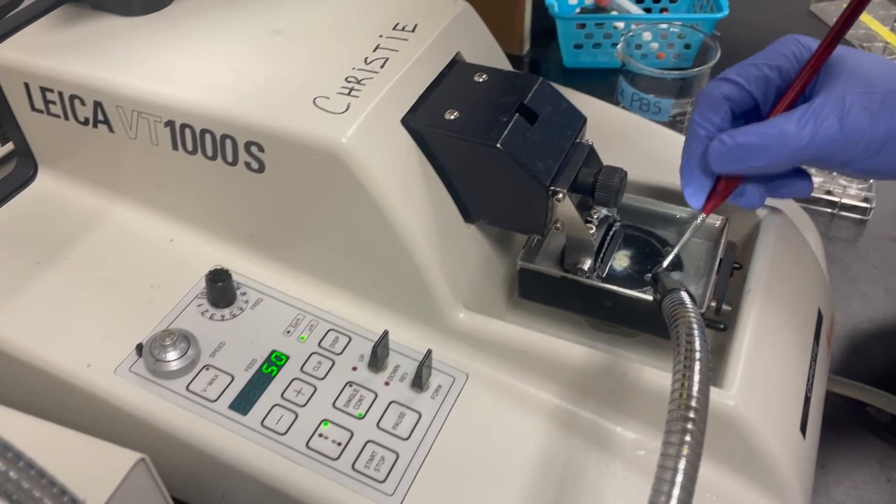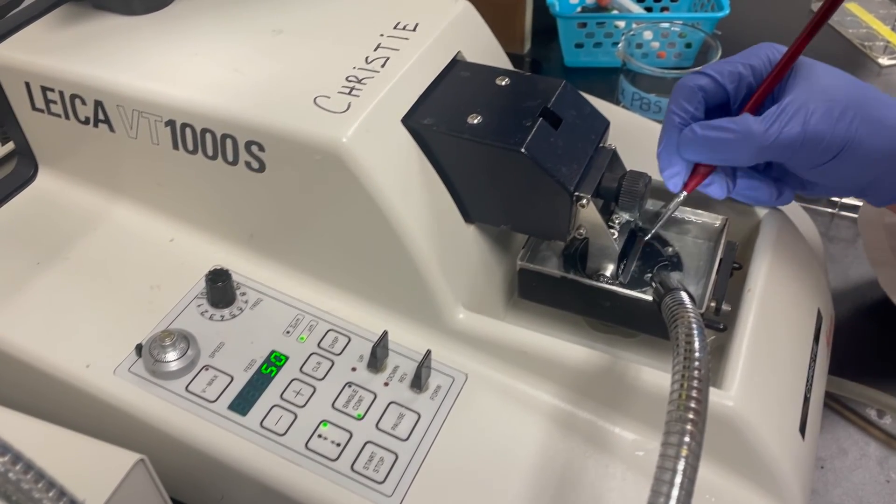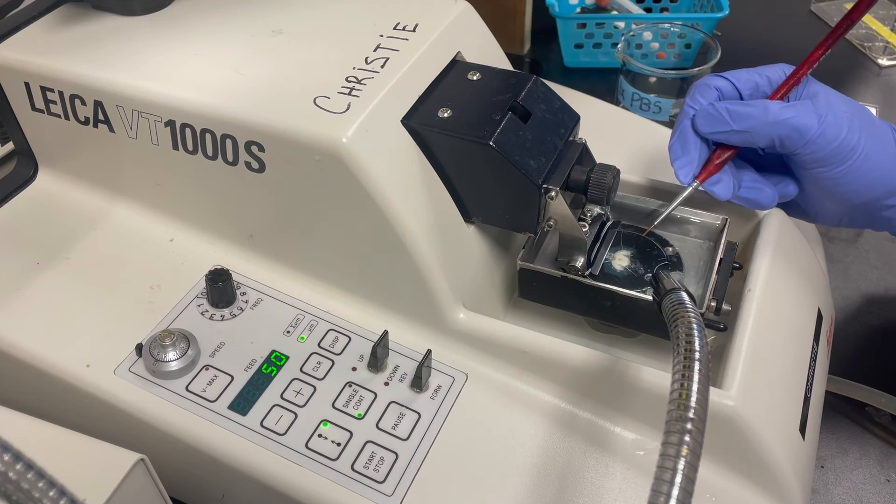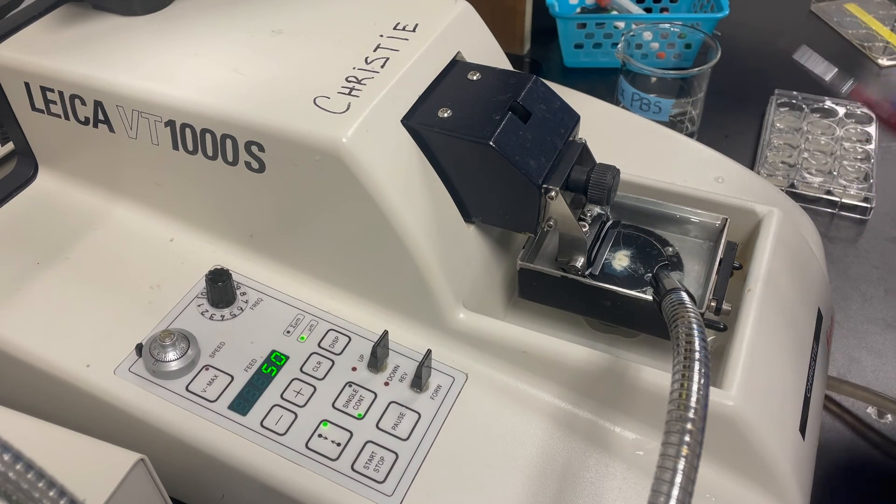Now once we've essentially reached the base of the brain tissue and there's no more sections to be harvested, you can turn off the machine by pressing the stop button and begin the disassembly.